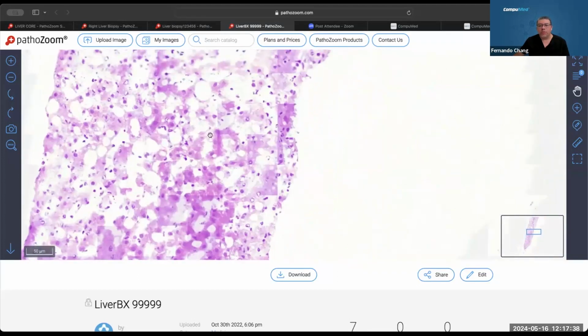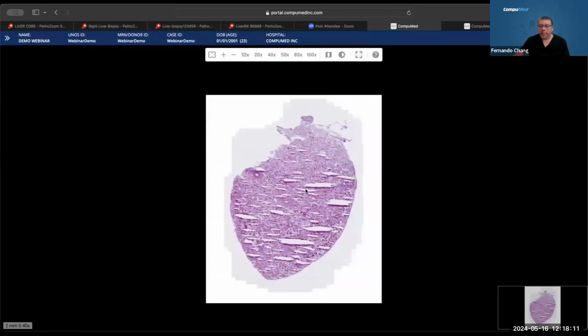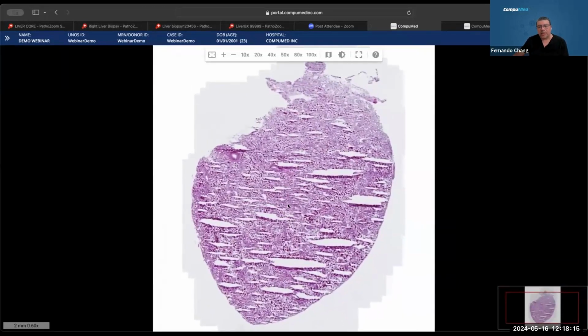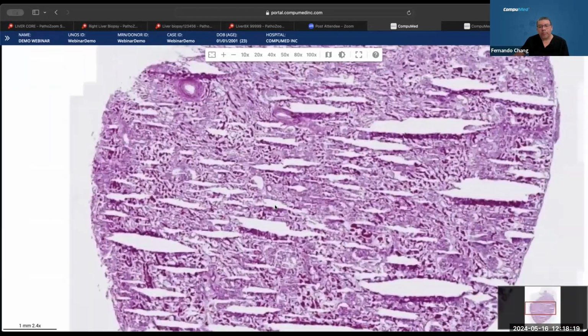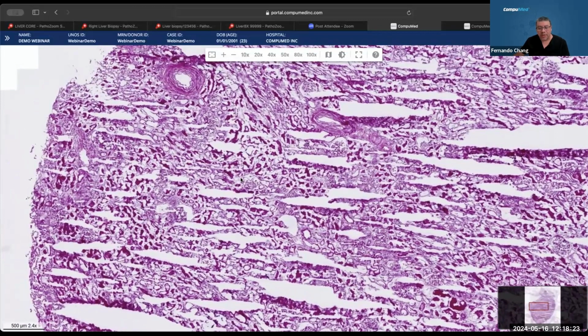Now for the other two, the 3 slides I have. And now this is a kidney. Okay, it's a good wedge, actually. It's a nice wedge. We have a lot of shattering as well here. And when we zoom in, the staining is a little bit intense too because of the thickness.